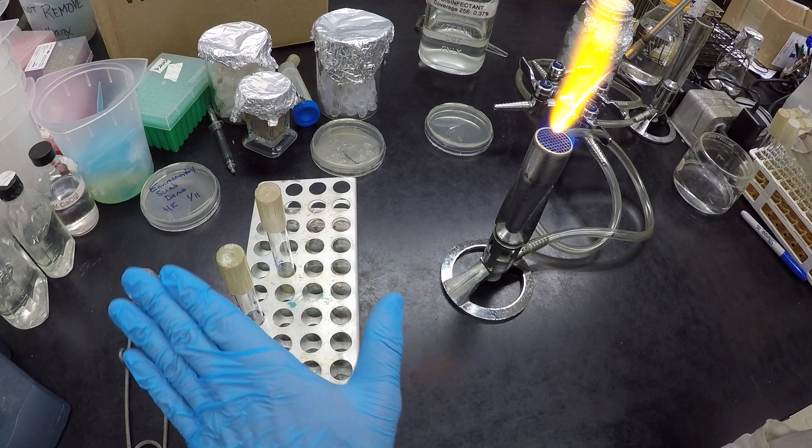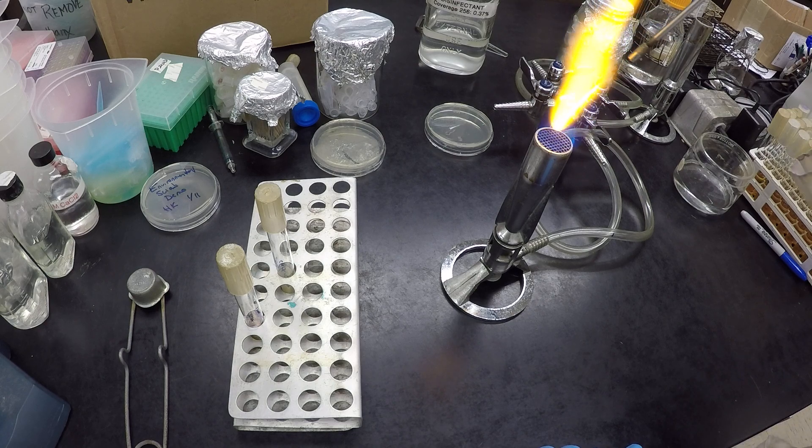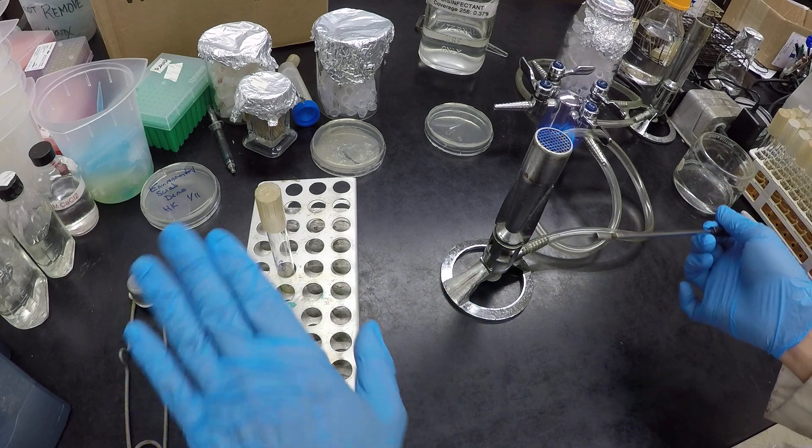And that's done. So now we have a very nice inoculated broth, and by tomorrow, that'll grow up to be a very heavily populated broth culture.